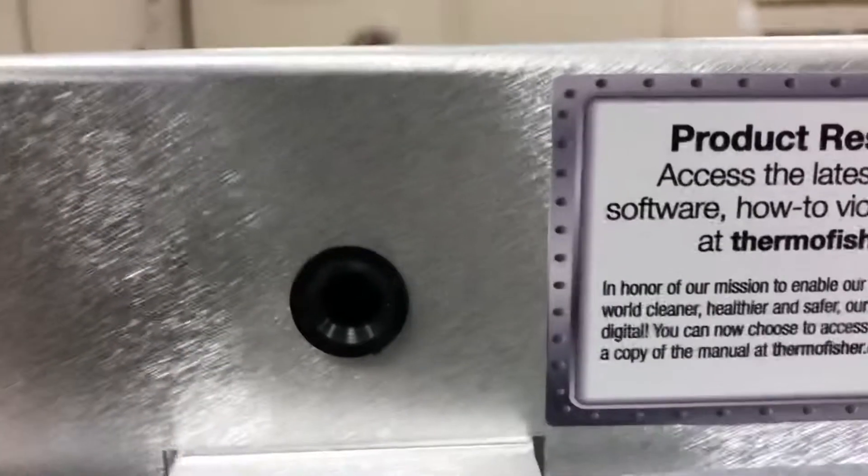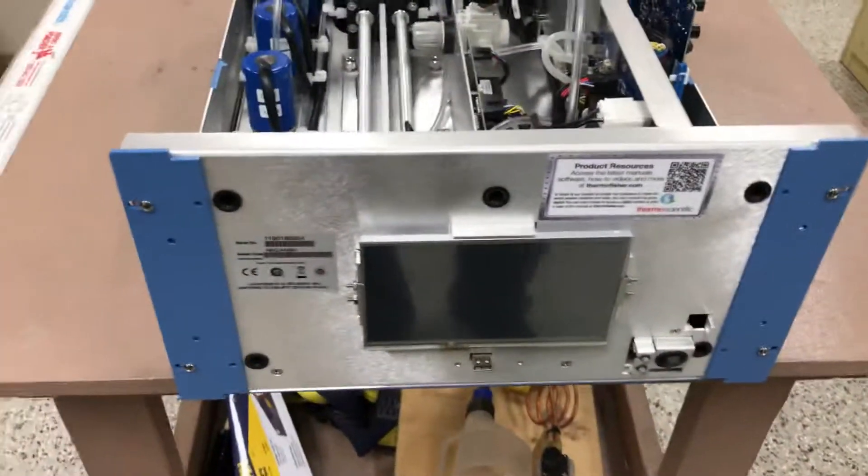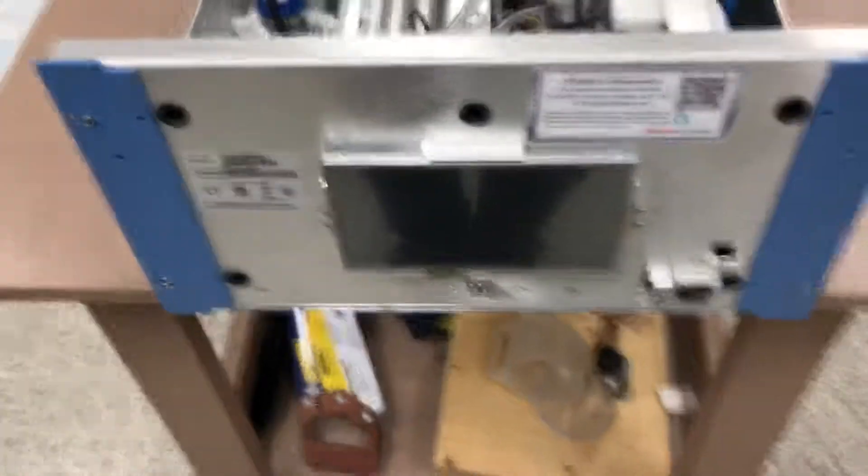All this is just a bunch of clips — simply a quick connect into these holes, just for a quick pop off. Easy access. If you have any questions, feel free to post your comments and I will respond. Thank you.